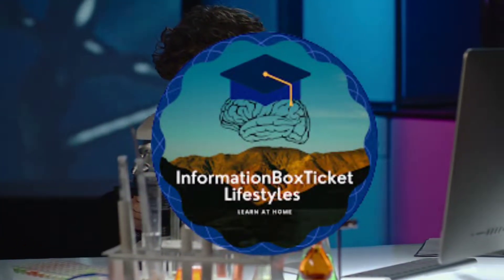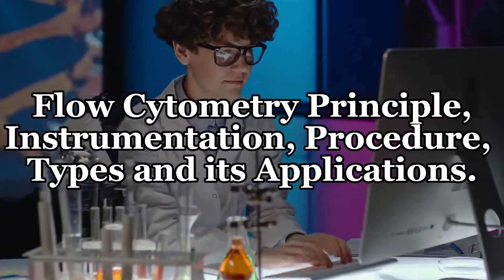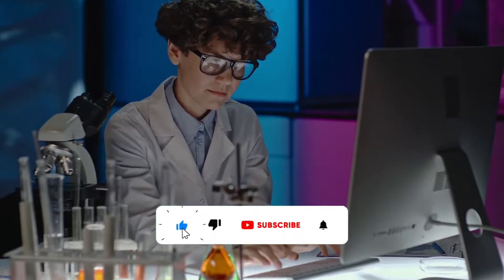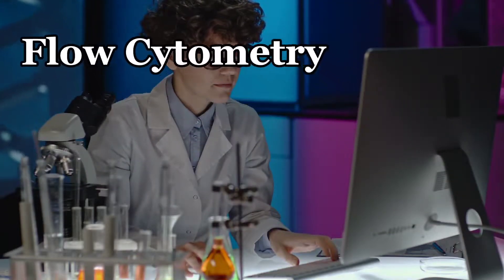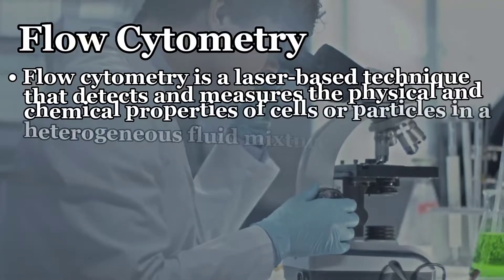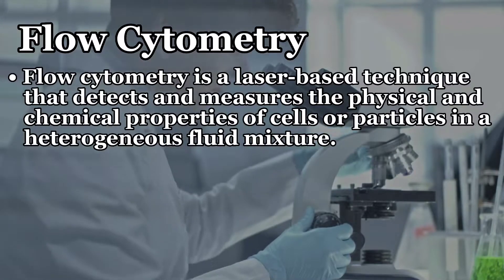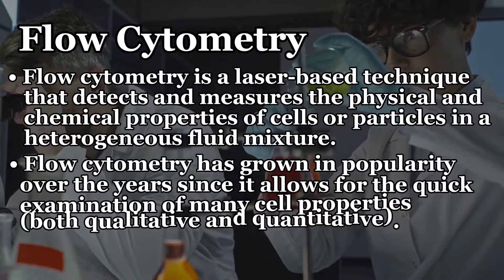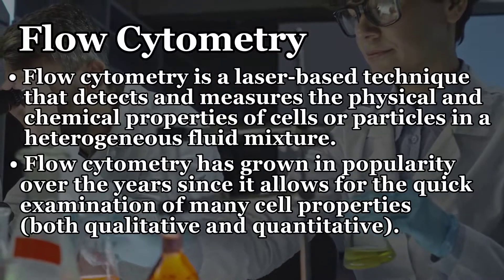Assalamu alaikum everyone. Information Box Ticket Lifestyle brings you flow cytometry: principle, instrumentation, procedure, types and its applications. Flow cytometry is a laser-based technique that detects and measures the physical and chemical properties of cells or particles in a heterogeneous fluid mixture. Flow cytometry has grown in popularity over the years since it allows for the quick examination of many cell properties, both qualitative and quantitative.